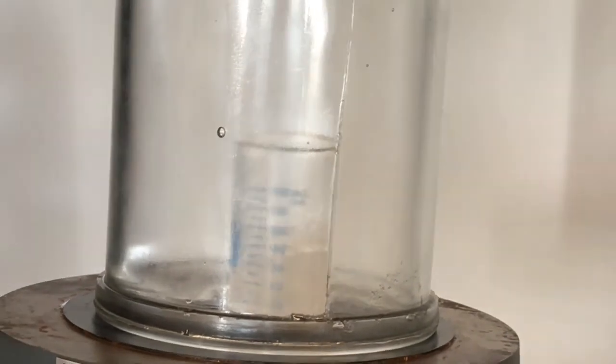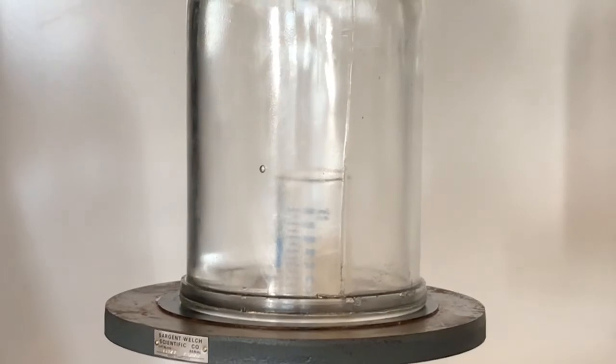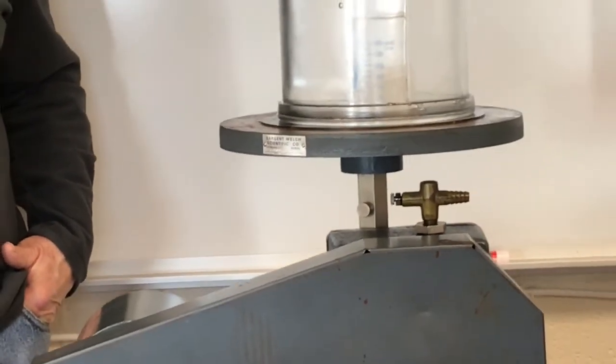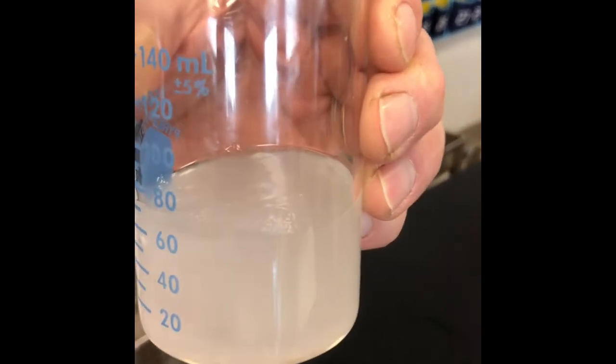Go look up triple point. See what you find. Here's the tert-butyl alcohol close up. And it's definitely much more solid than it was when it went in.